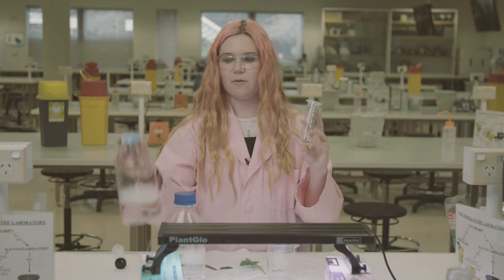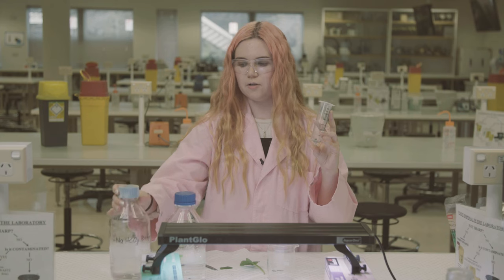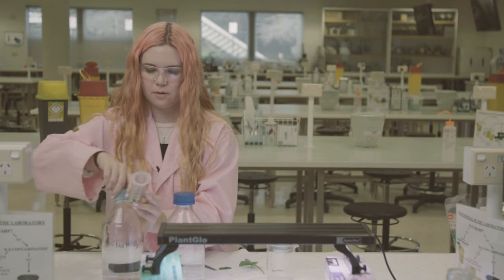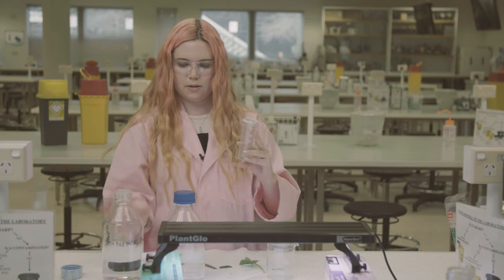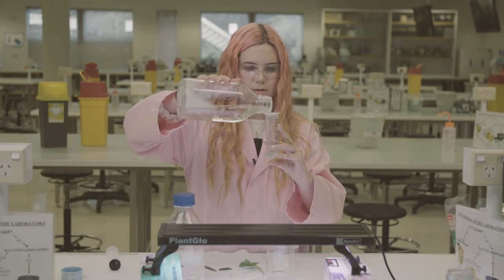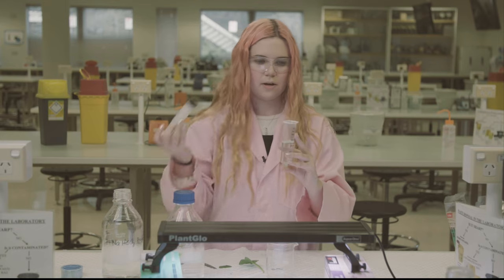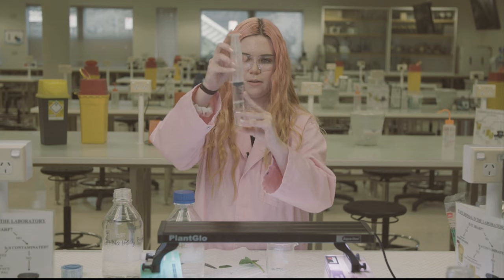We then take one of our solutions. I'm going to show you how to do it with the baking soda, which has carbon and will allow them to photosynthesise. So fill it about halfway, and then block the bottom like this.